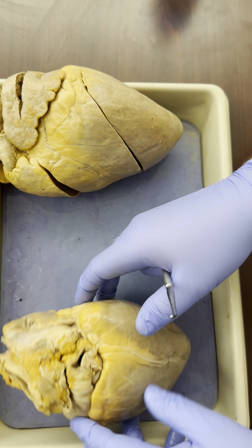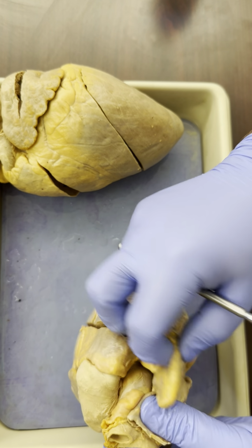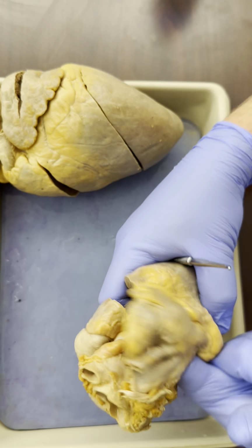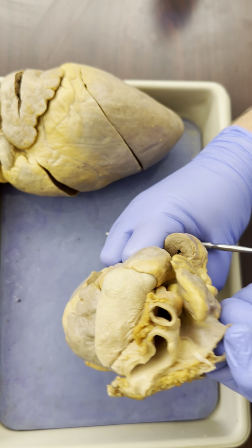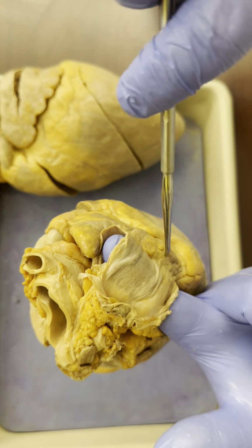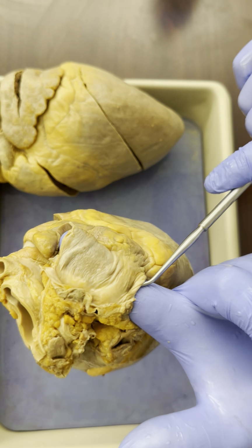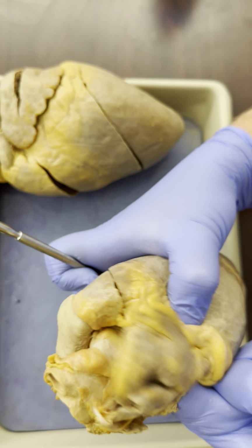Flip the heart over, looking at the back, at the posterior side, orient ourselves. Here is the right atrium. What's going into the right atrium? Well, this vessel goes into the right atrium, or, see if I can get my finger to come through here, this vessel also goes into the right atrium. So this is coming from the top. This is the superior vena cava. Down here is coming from the bottom, so this is the inferior vena cava. Both of them go into the right atrium.